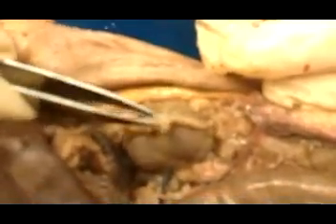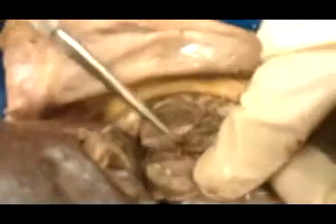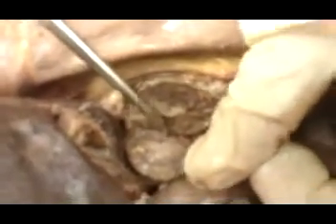Now, when that's cleared, the kidney looks like this. Immediately on the surface, we have this fibrous renal capsule. So I'm going to pull back on the renal capsule right there. Okay, that's the renal capsule on the surface of the kidney. Now, when you open up the kidney, you have the cortex, which is the outer part. This is where all those renal corpuscles were. You have the medulla, which is the deeper part. And then right at the middle there, it looks better on this side, you have the renal pelvis. This is where the urine collects.